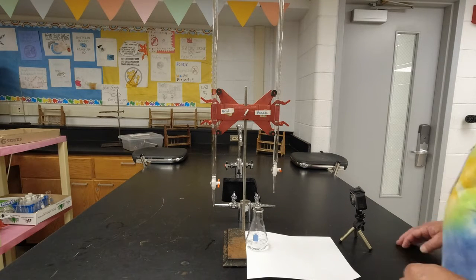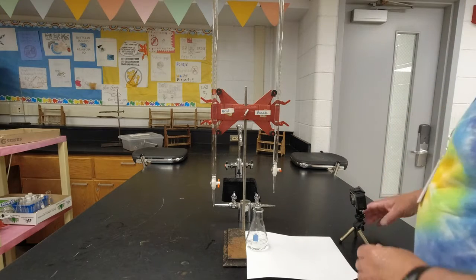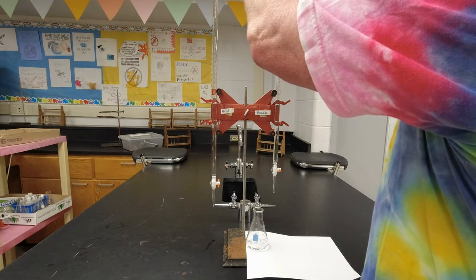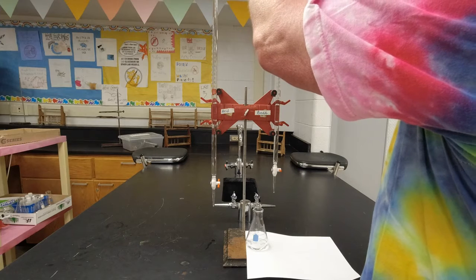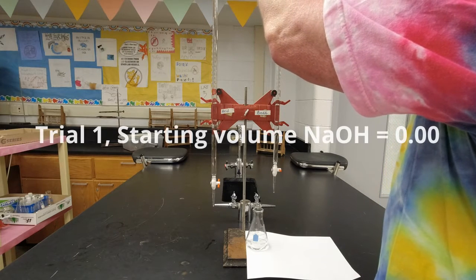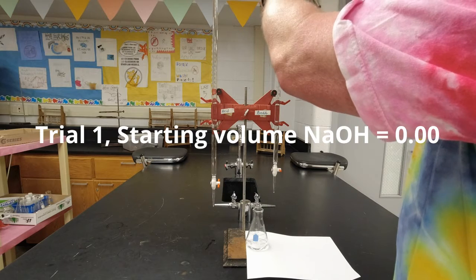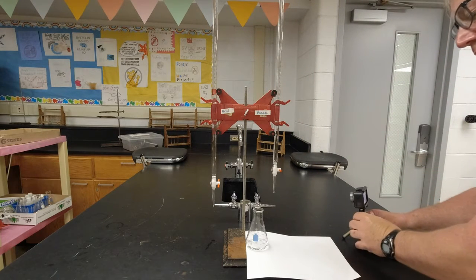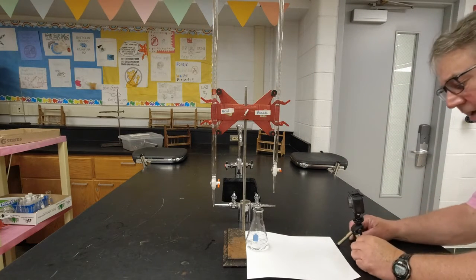So what I'm going to do is right now, if I look up here, my acid is right at, or excuse me, my base is right at 0.00. So I'm not going to focus on this. What I'm going to do is focus on what I got going on right here.